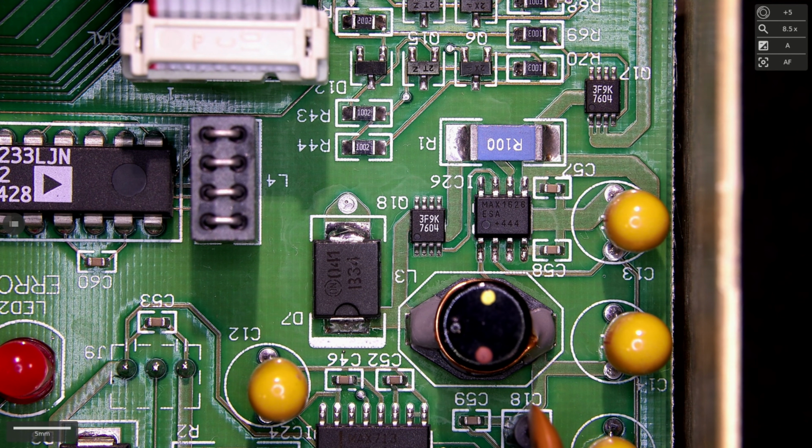Now there is something about this circuit that troubles me a little bit. If you look here, this line is the main power supply coming from the outside. That's where we were applying the 15 volts. And we do have a soft start with this MOSFET, which then enables the power supply to reach this resistor and then ultimately reach the Max 1626 DC-DC converter power supply input. This then controls our switching MOS transistor over here, which is in series with this inductor and ultimately produces the output voltage in a buck conversion fashion.